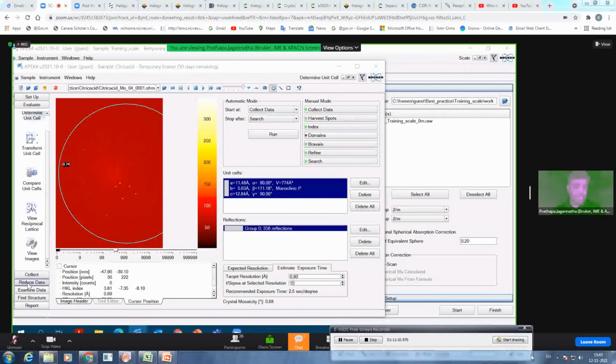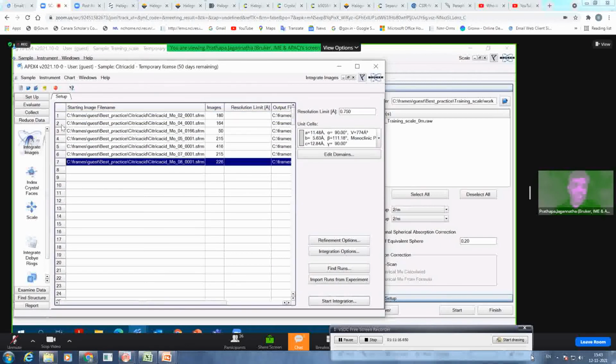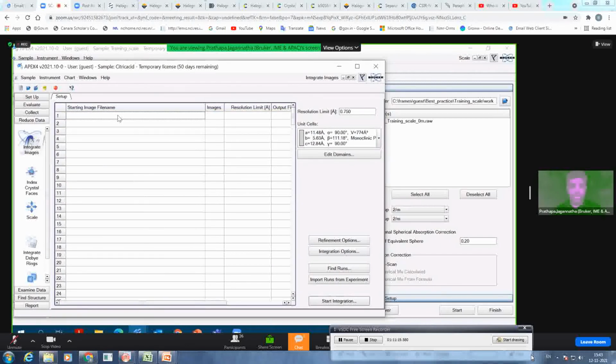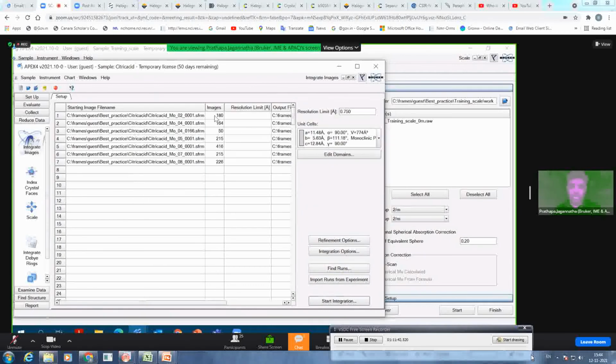Okay, so then I just quickly move to reduce data, integrate images. Generally you don't see the frames when you click on integrate images. You just open integrate images like this, and you need to set the resolution up to which you want to integrate. I know this data has up to 0.75, so I kept it at 0.75. This is your unit cell which you have indexed, and then you just call in the runs, and select all runs, including the fast scan, because I need to replace whatever the overflowed reflections. That's why I'm including the fast scan as well. And then I can start the integration.